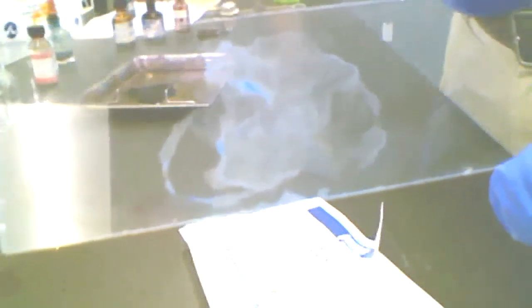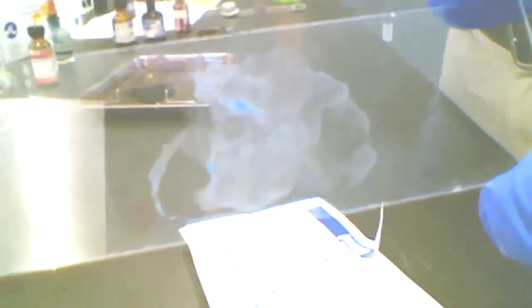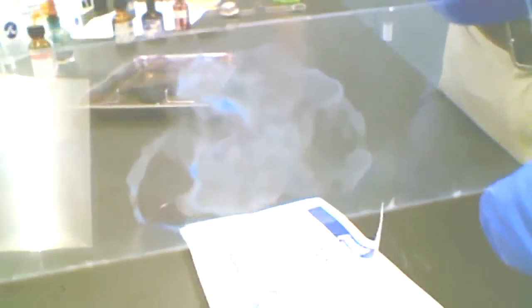Again, this is a really thick smear. A lot of times you won't see the smear this distinctly when it's done, and those are actually sometimes better slides. But for quick and dirty, just asking is anything there, were there organisms growing on that slide, this will enable me to do that. That's principally why we would want to do this.